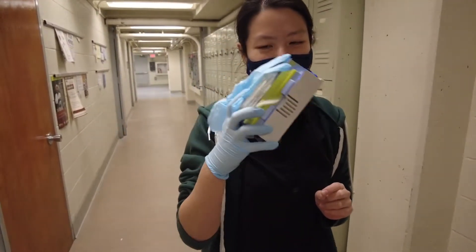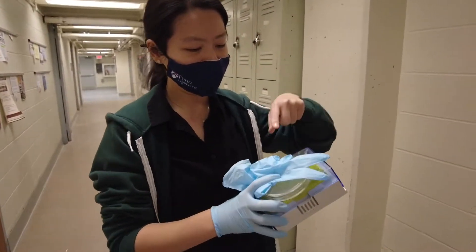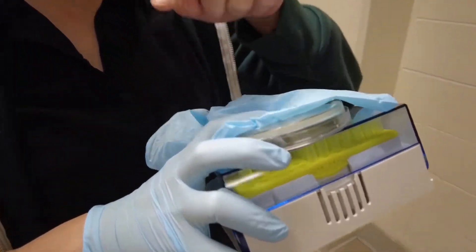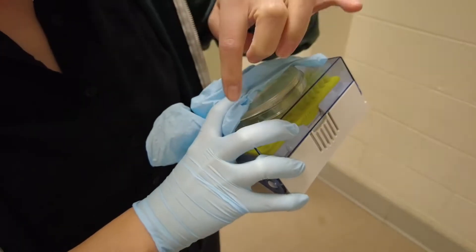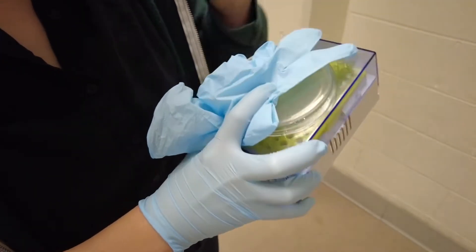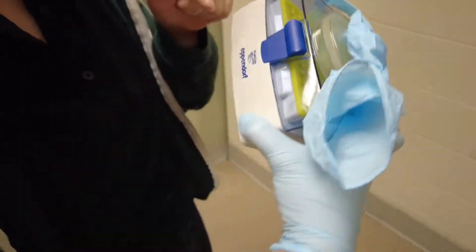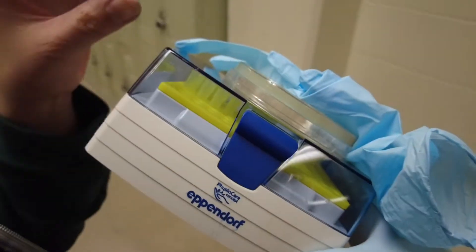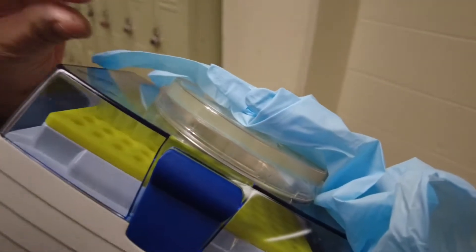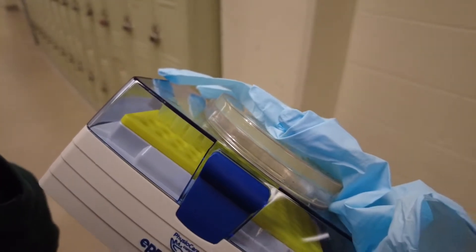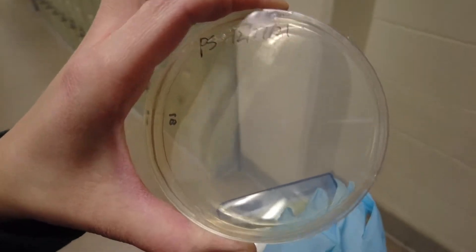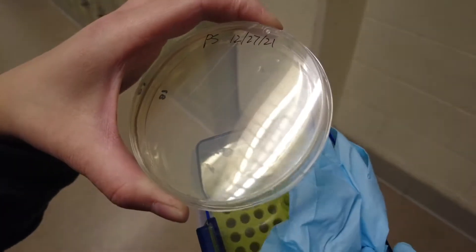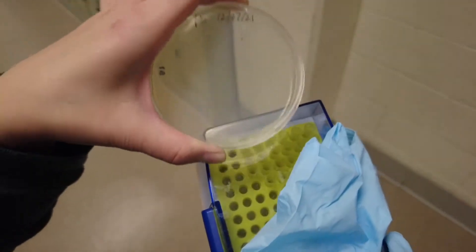This is the tutorial for streaking out. We take the LB plate and sterile tips. I'm demonstrating with non-sterile tips, but I sterilized these two here. Make sure the LB plate has adequate depth so it's not dried out. It should be a good plate with nothing growing on it, and not too wet, because if it's too wet everything will merge together and you don't want that.